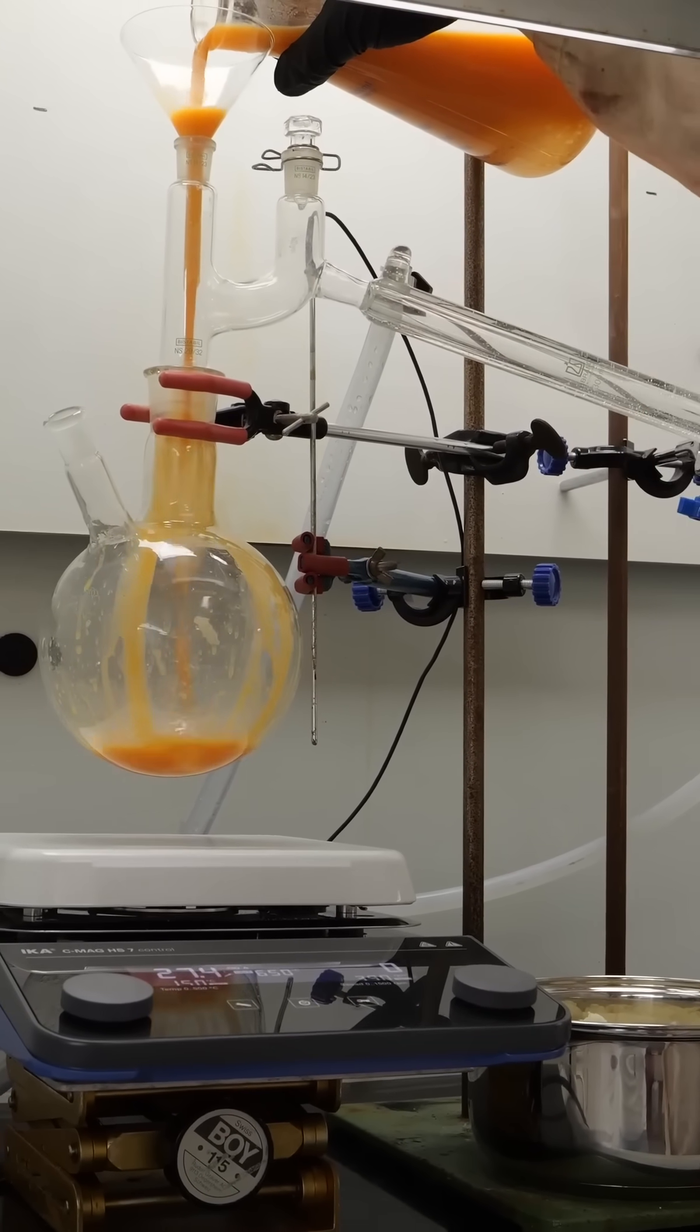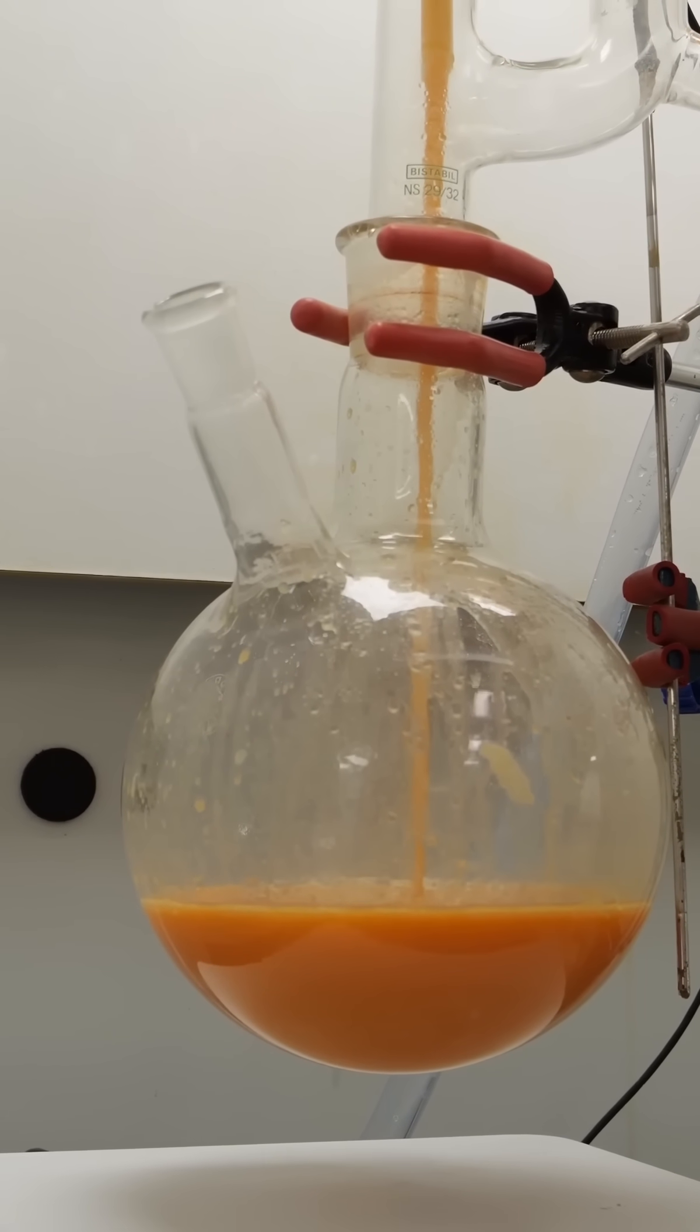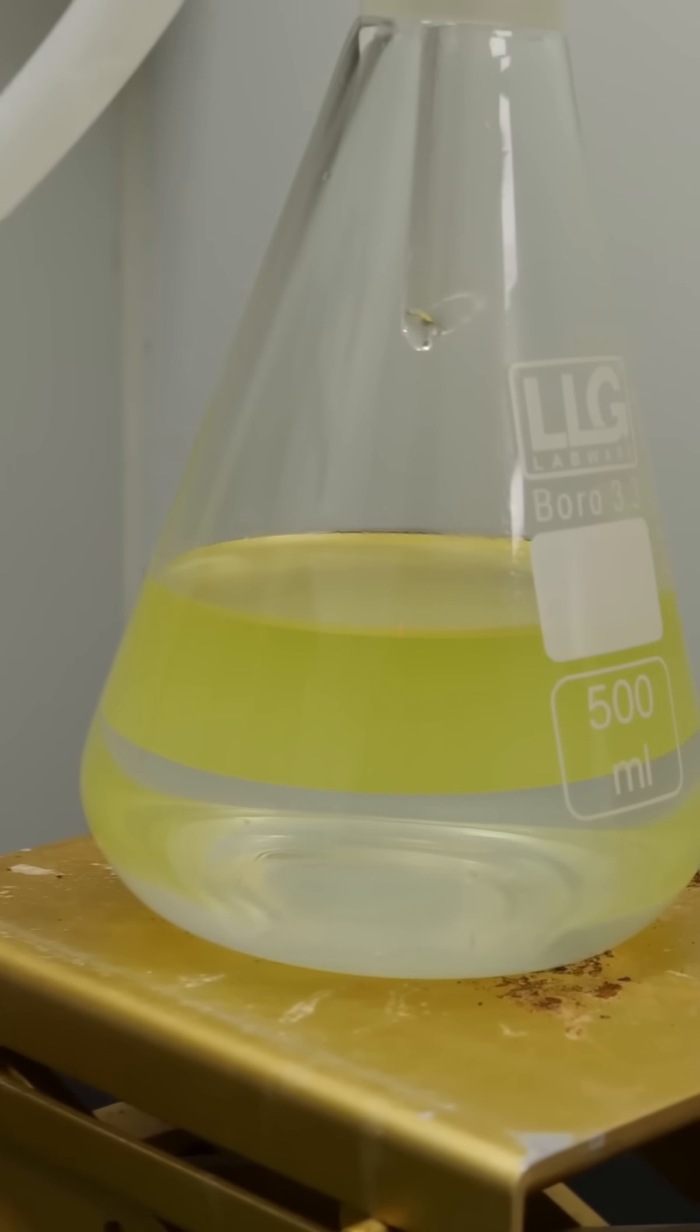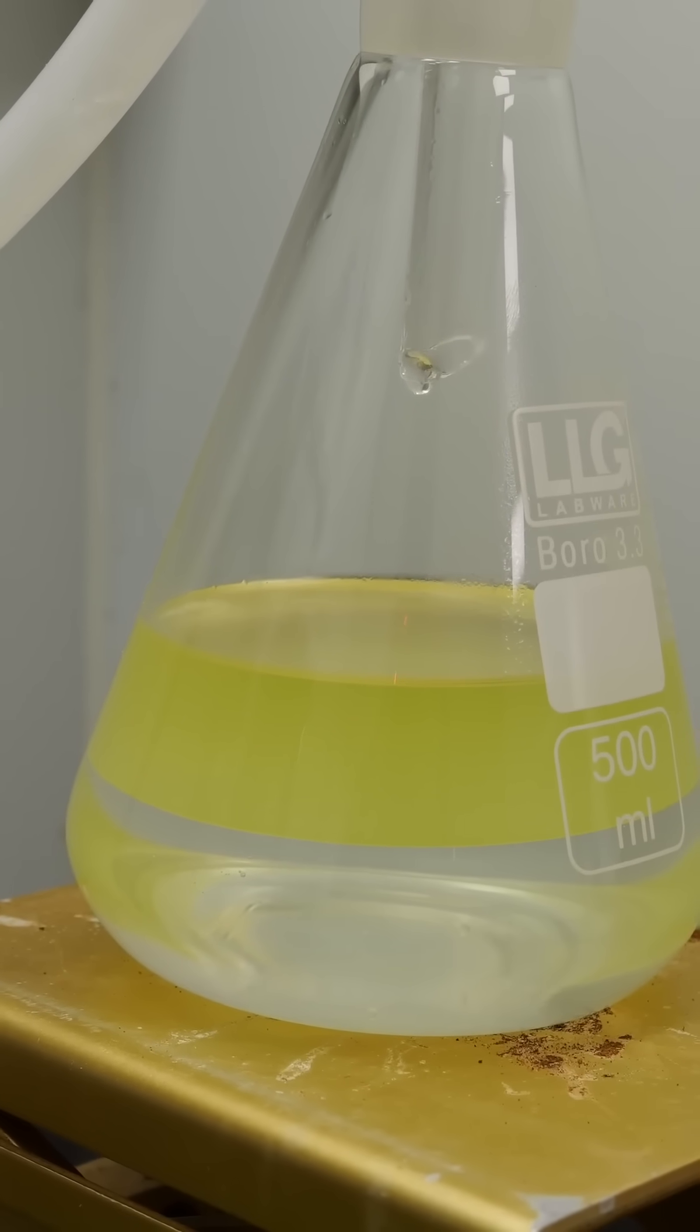A distillation. I pour the pyrolysis product into a flask and start the distillation on our best hot plate. After the distillation, we finally have crude gasoline.